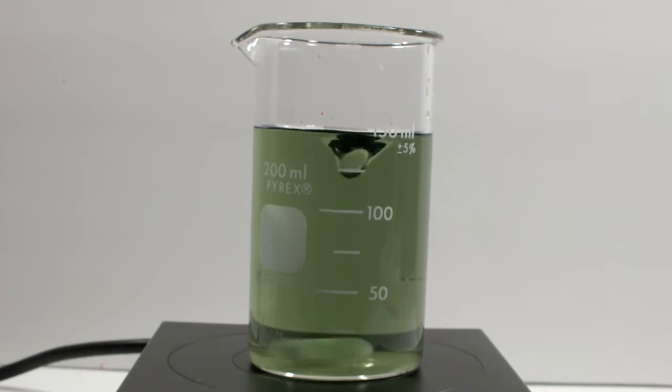And it transitioned to green. So we still have some sort of failure, and the fact that the first two solutions didn't produce an amber bromine color again indicates that perhaps the potassium bromate is no good either. But there is something else interesting that happens.